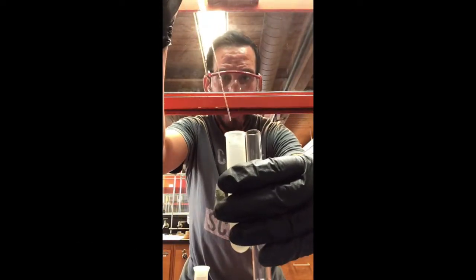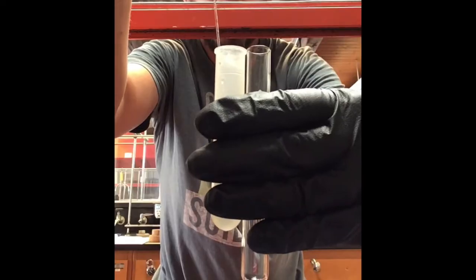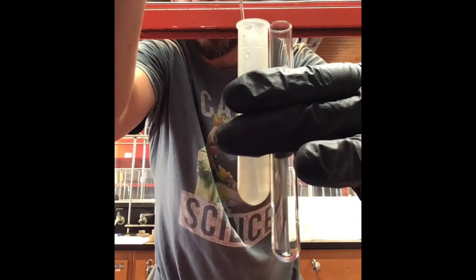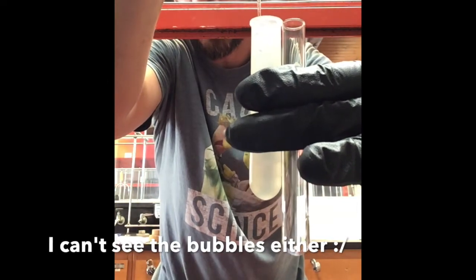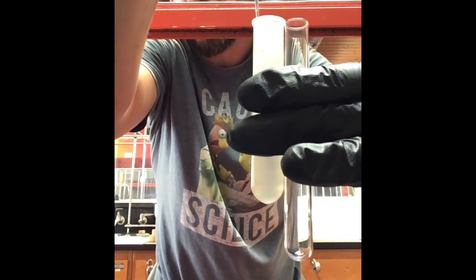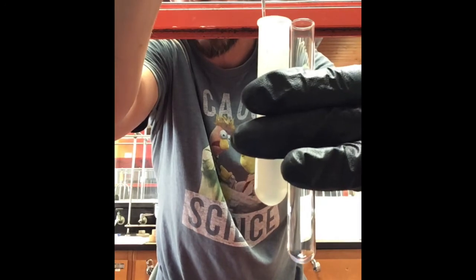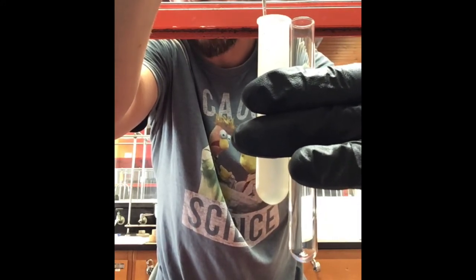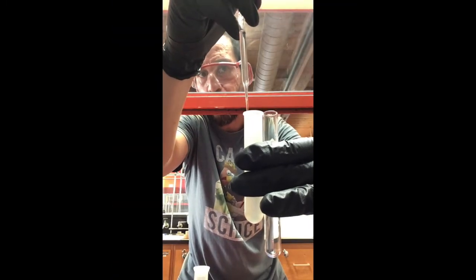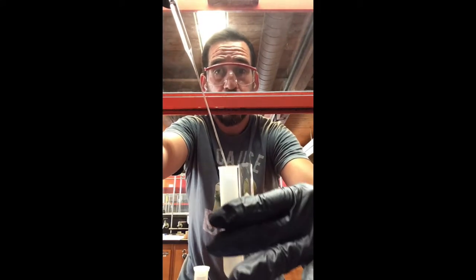As I do this, I'm going to squeeze out, and you can kind of see the bubbles maybe. You're going to want to get in only the bottom layer though, right? It's really hard to do when you're working with a centrifuge tube that's kind of opaque. But that's okay. If you get a little bit of water in there, we can separate that too. Okay, just because it's hard for me to see at this angle, I'm going to go ahead and call that done.